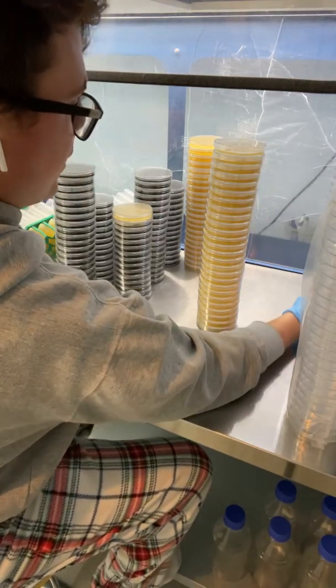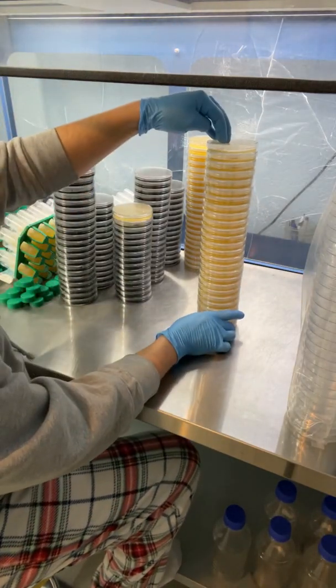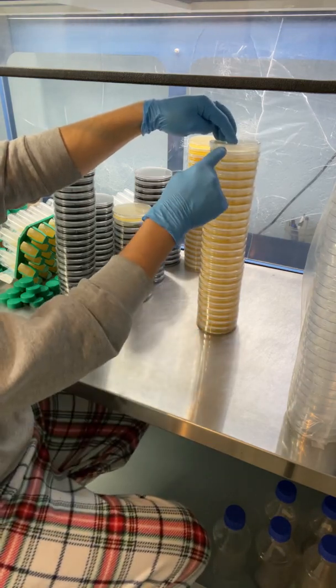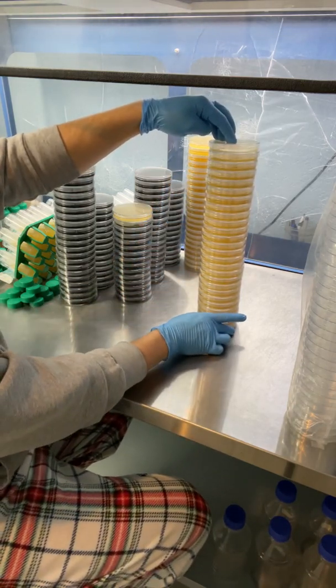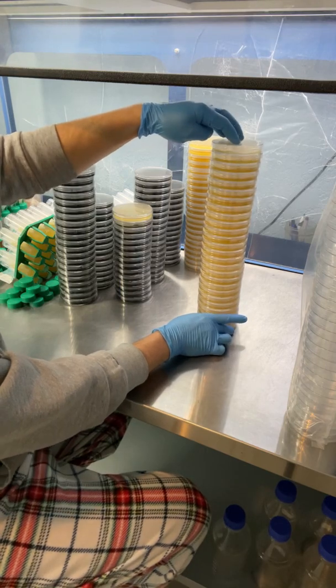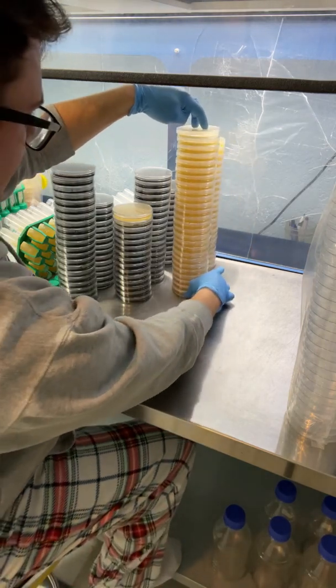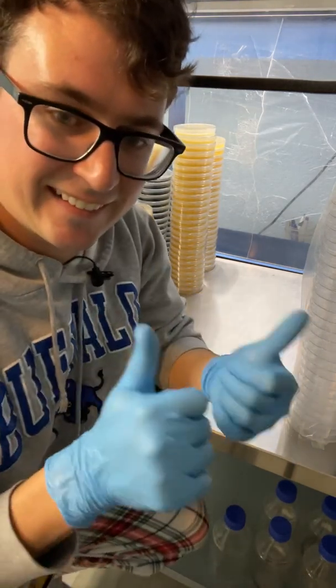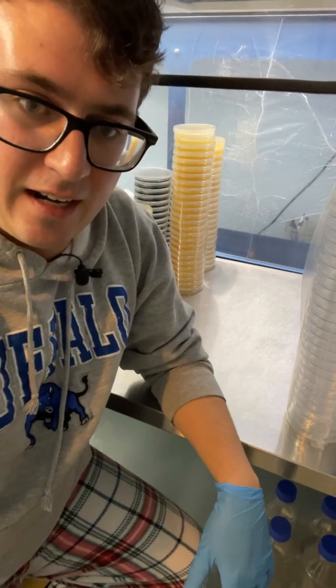I guess I didn't have another bottle. A little trick for the end — if you're short, you can just kind of take the tower and twist a little bit. And there we go. Let's see if I got any questions.